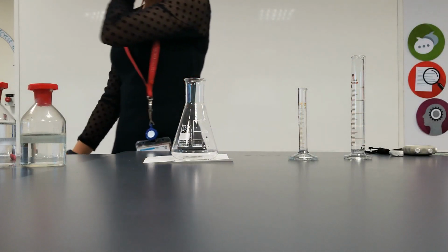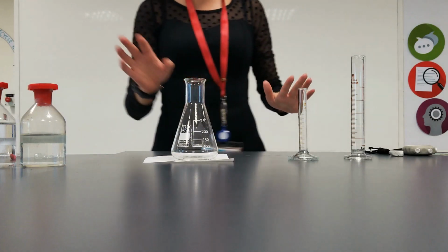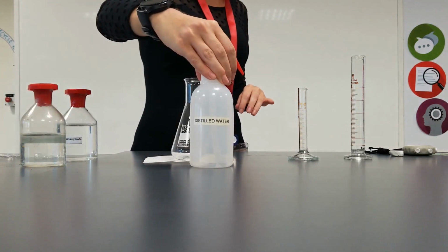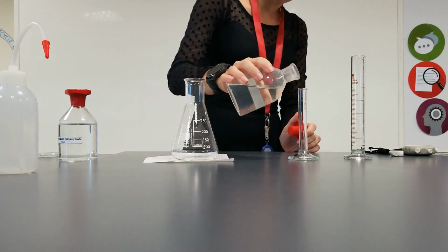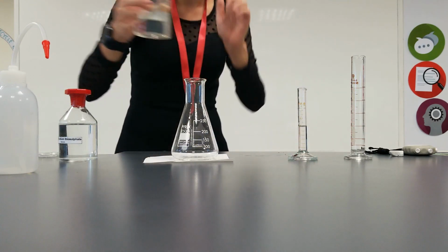Okay guys, so this time we're going to do the 0.14. So we will need to dilute down our sodium thiosulfate to a certain extent using some distilled water. The easiest way to do this is in the measuring cylinder before you put it in the conical flask. So again, we need 5 centimetres cubed of hydrochloric acid. We're not changing anything about that chemical, having the same amount of hydrochloric acid for reactant every time.